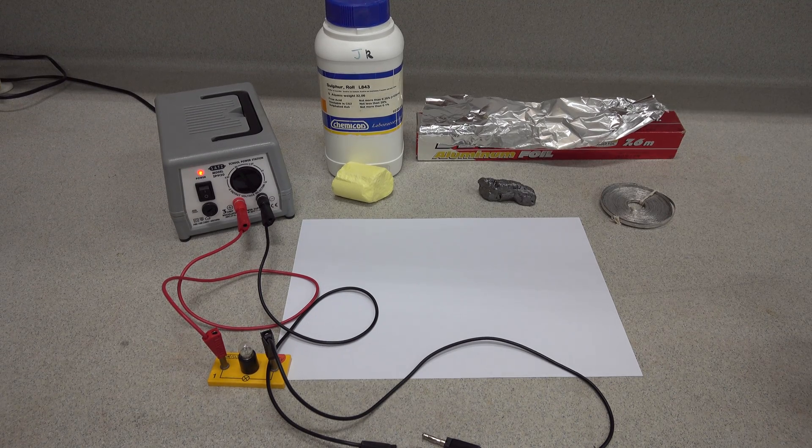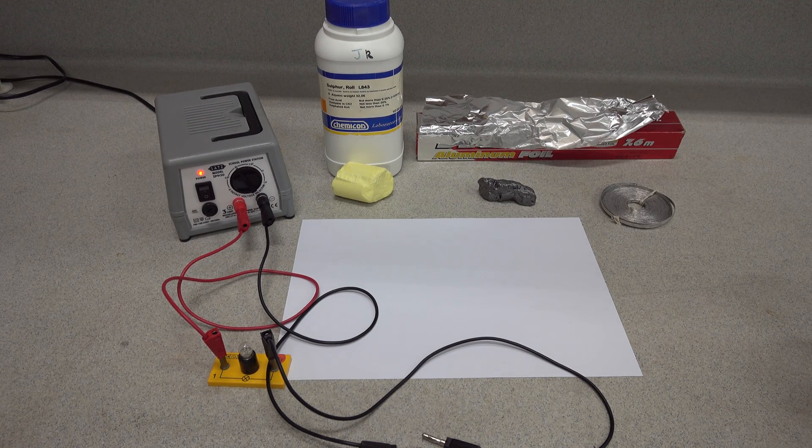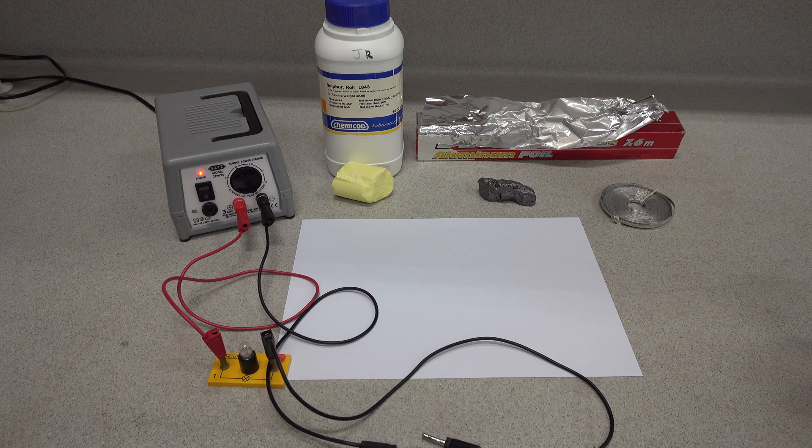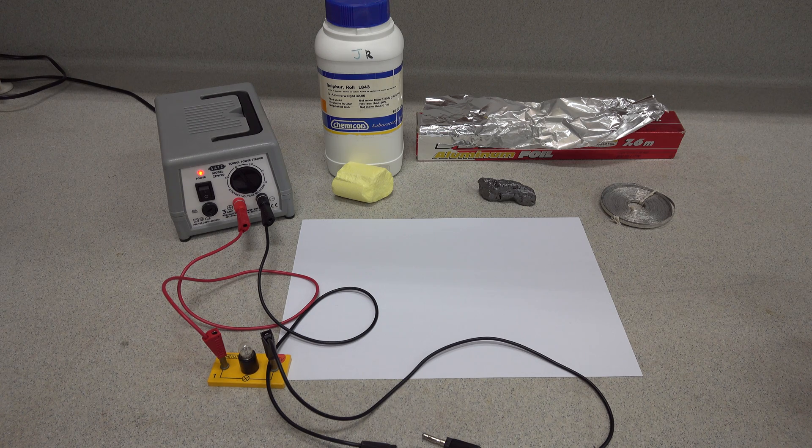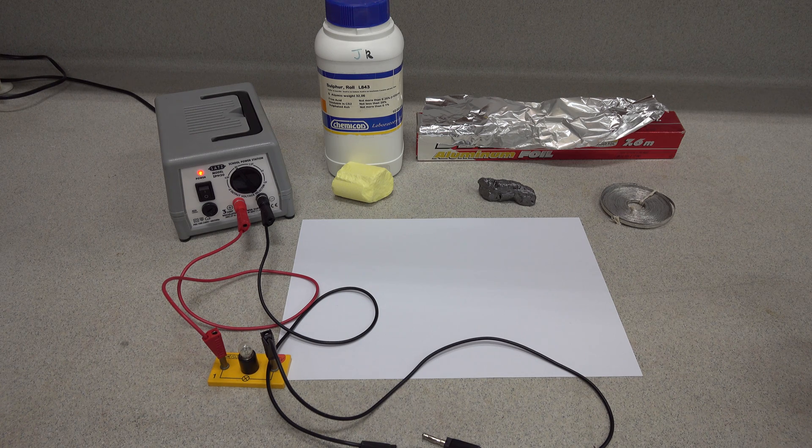Let's look at a simple electrical conductivity experiment for a range of elements. In each case, you should note down the symbol for the element and whether it conducts electricity.